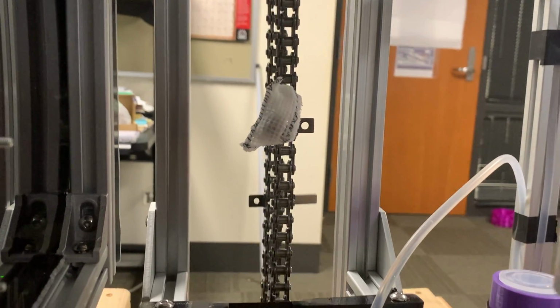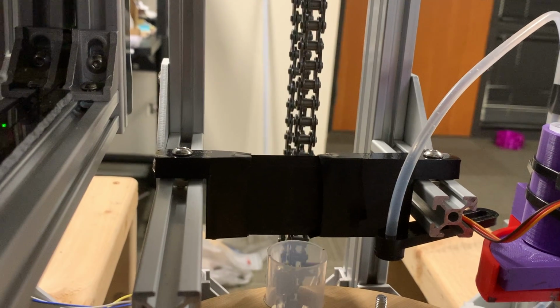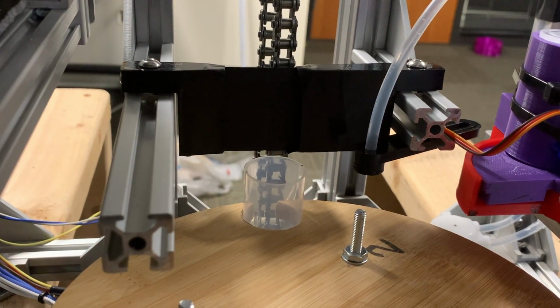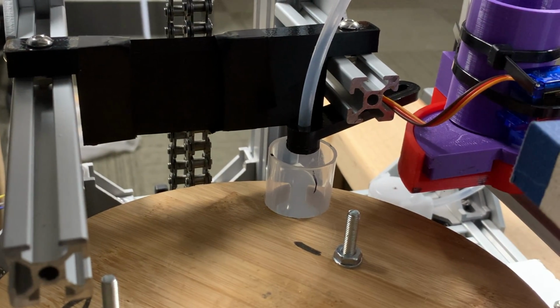In this video, we have used a gauze material to act as a mesh to collect the sample. However, the client can use any material that they see fit. The sample tube is then carried to the next stage via a rotating disc that is powered by a mini 12-volt DC 3.5 RPM motor.